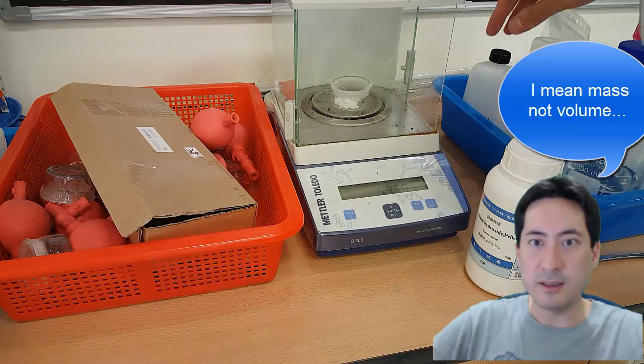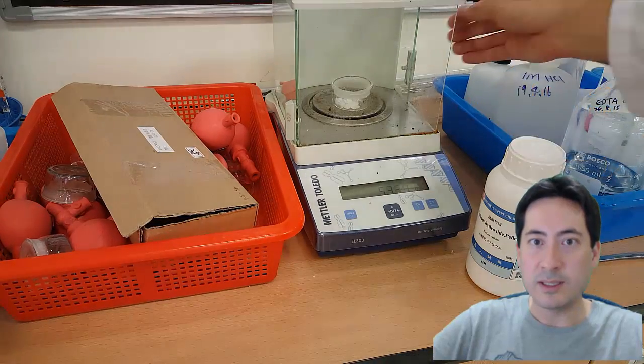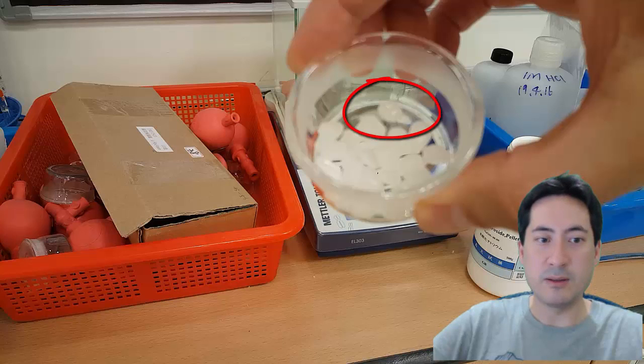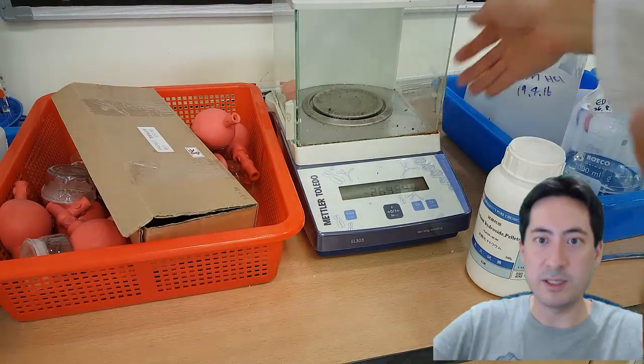What you can see here in that weighing boat there is that it's starting to get a little bit shiny. And so what's happening is the water from the air is starting to grab onto it because it's so concentrated. So that's going to affect your error as well. So you need to be quick about what you're doing with these things.